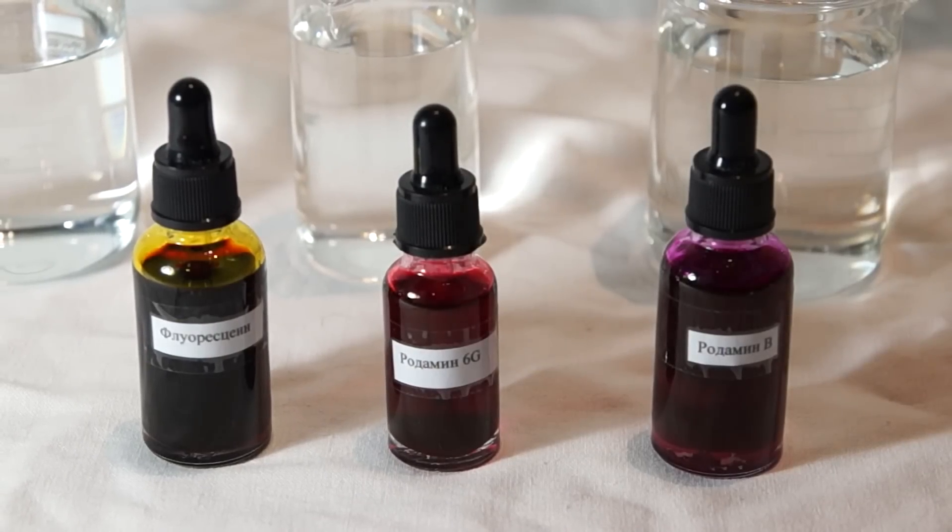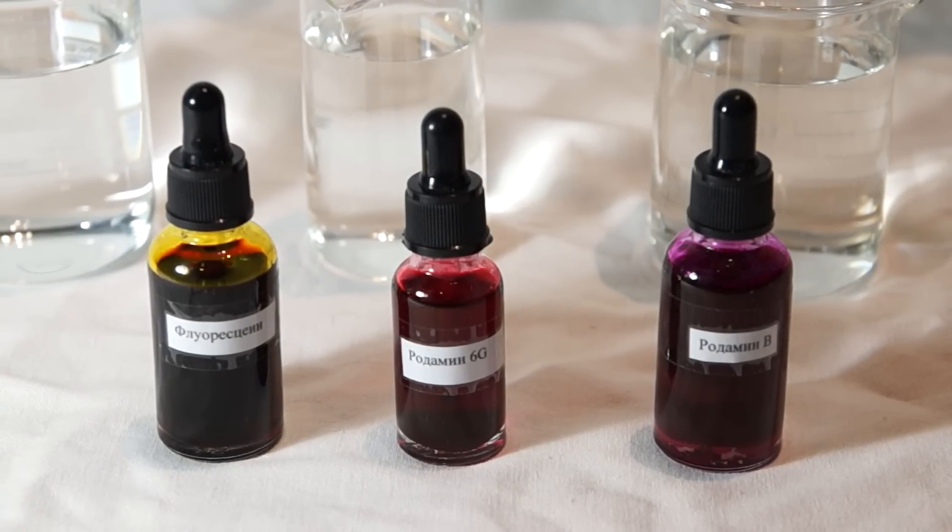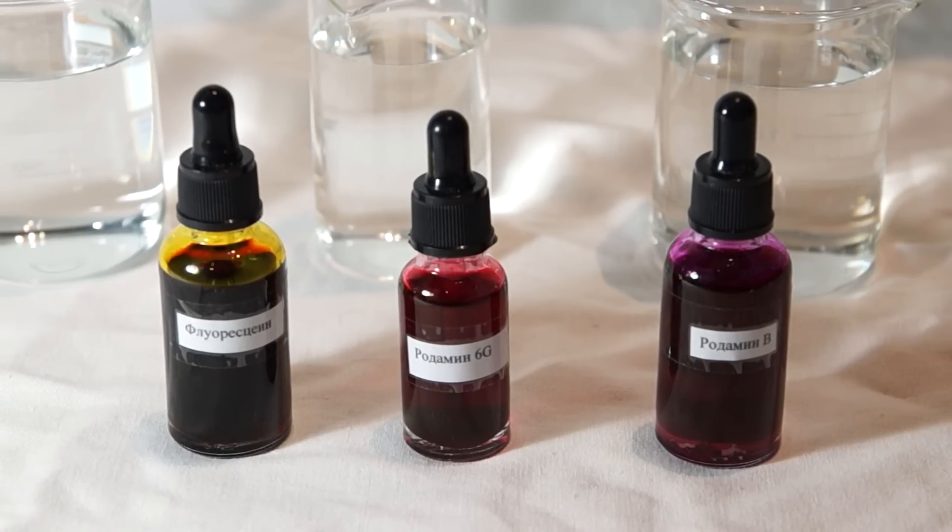For the fluorophores I will use the following materials: Fluorescein, Rhodamine-6G, and Rhodamine-B.